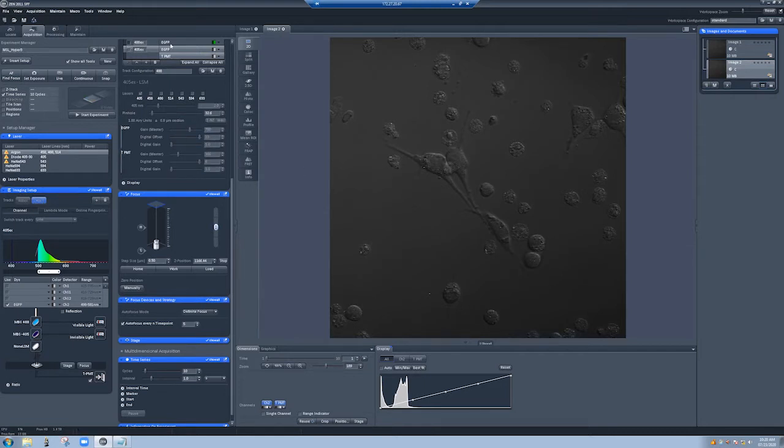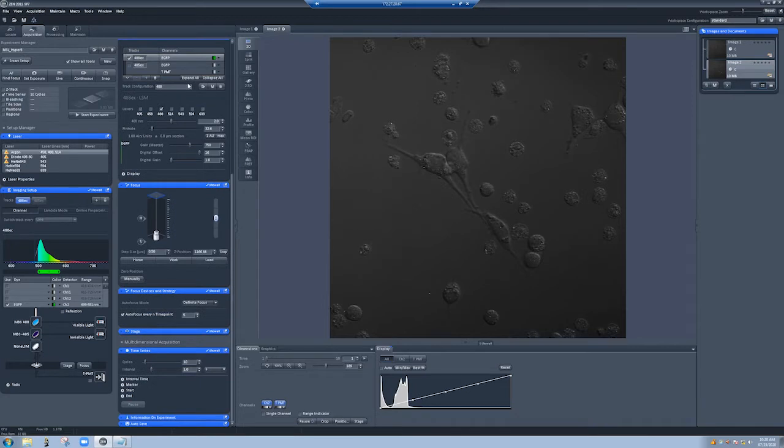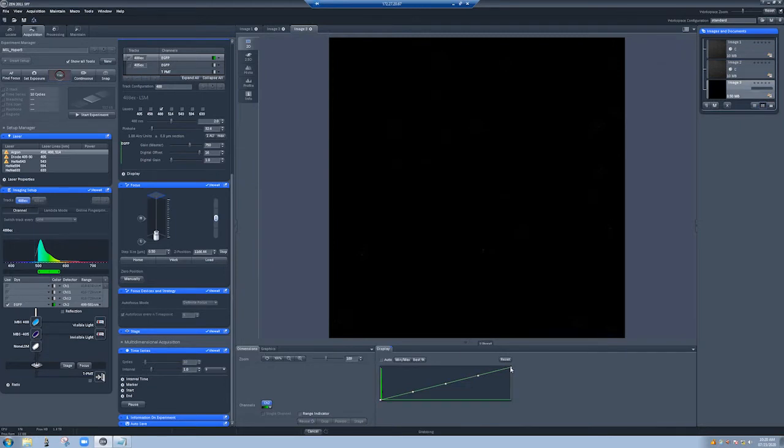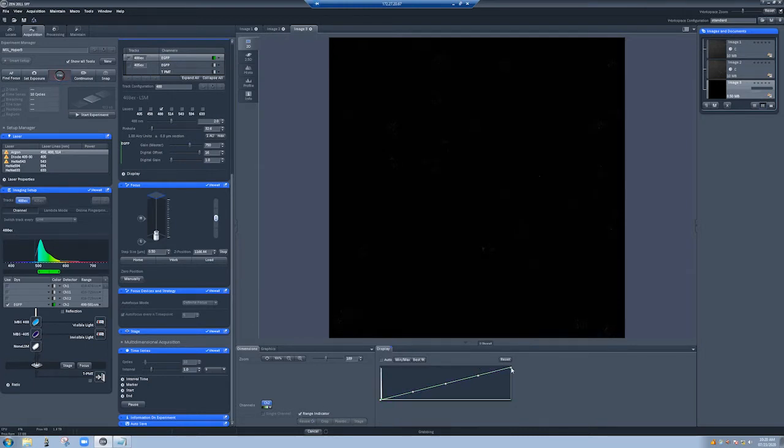This is something that I'm optimizing right now myself. So we have samples, and there's two channels. One is we hit it with 488, and we get emission in the GFP range. Let me go to live and see if we can find an area. Okay, so there doesn't seem to be much here. Okay, let's see.